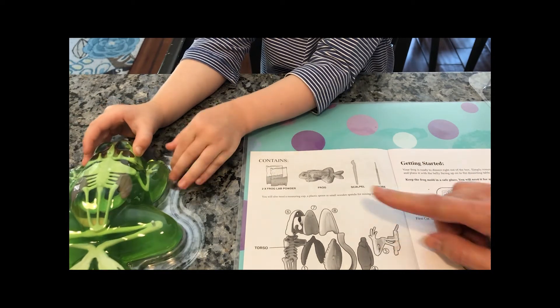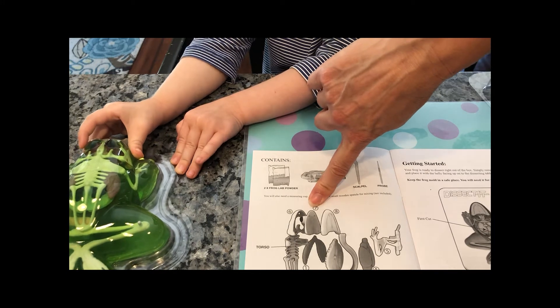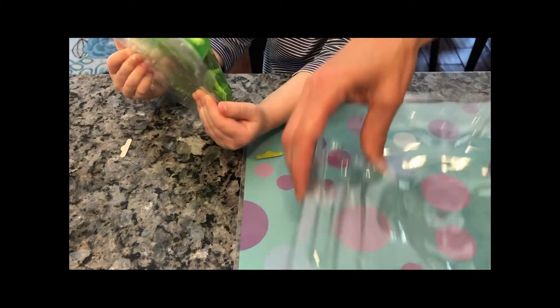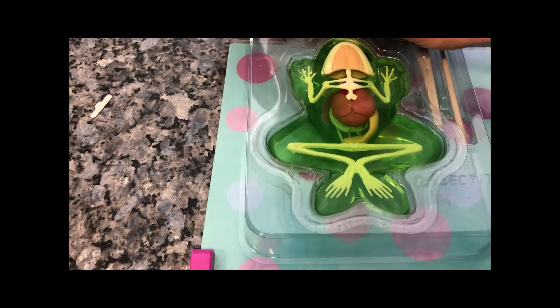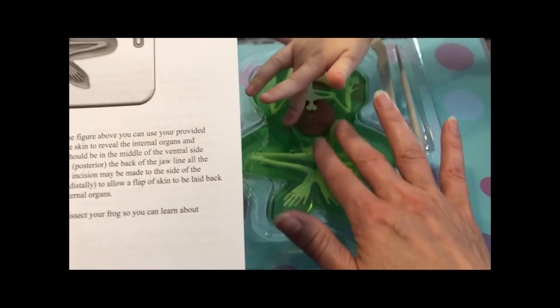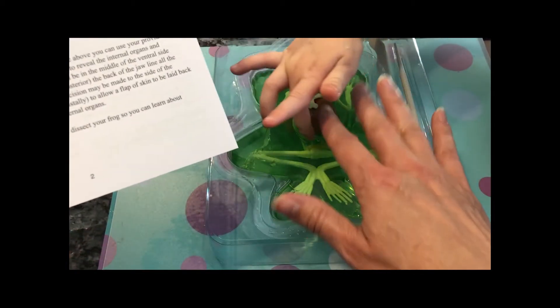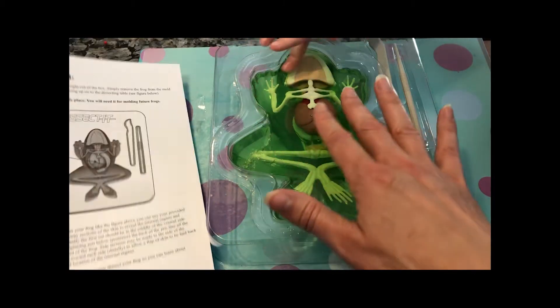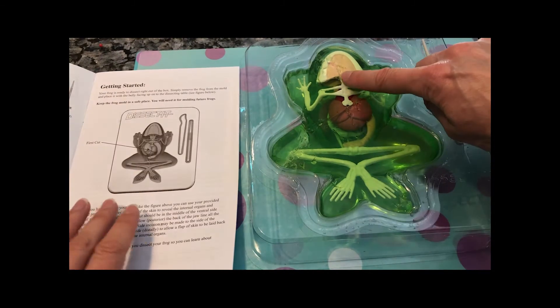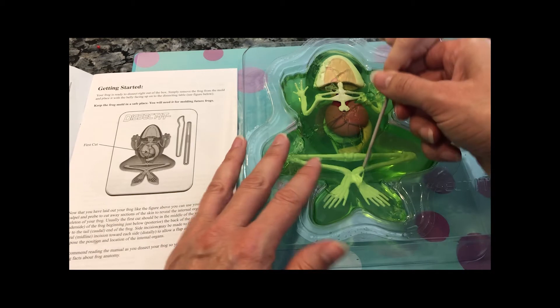Okay, so we have ribs. We also have the skull, brains and eyes, and a jaw. I think this is supposed to be our dissecting table. Alright, we got her open finally. It's slimy. The first cut should be in the middle of the ventral underside. So this is the underside of the frog — it's belly. Let's start the way it shows in the picture, from here down to here. Just a straight line, straight line all the way down.